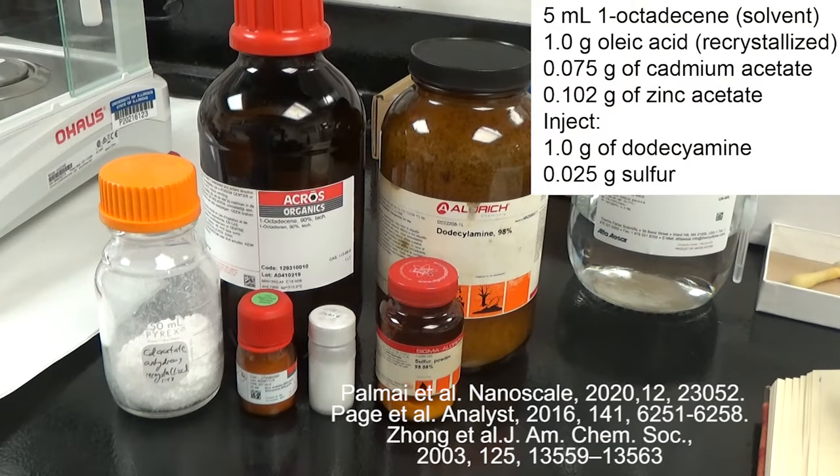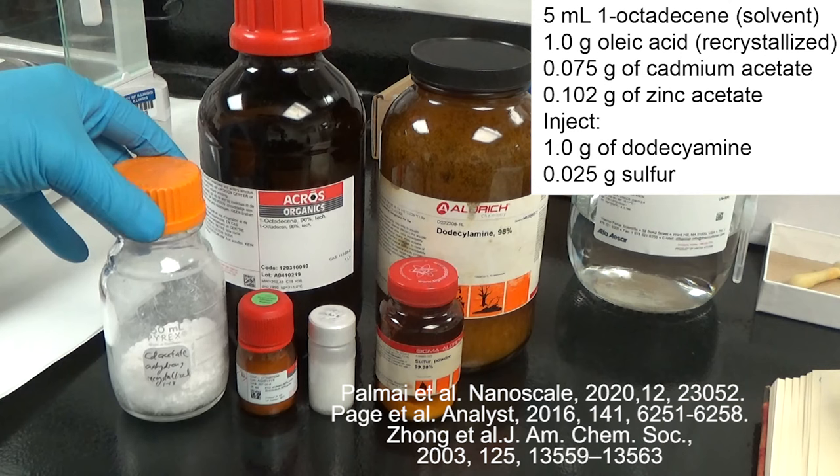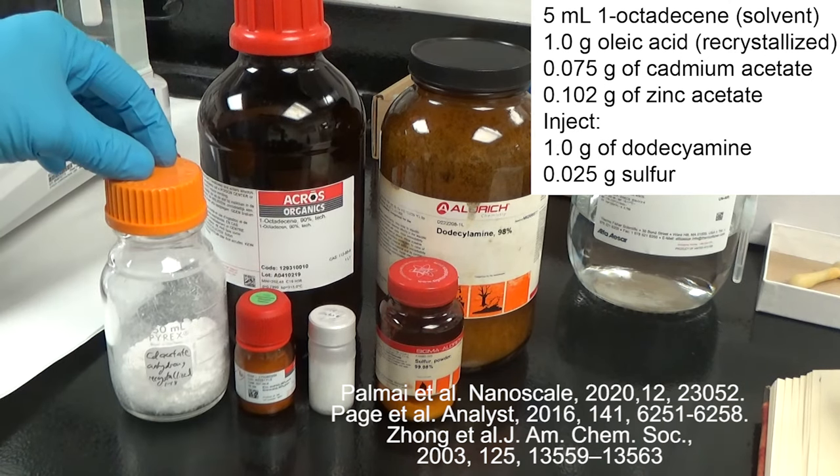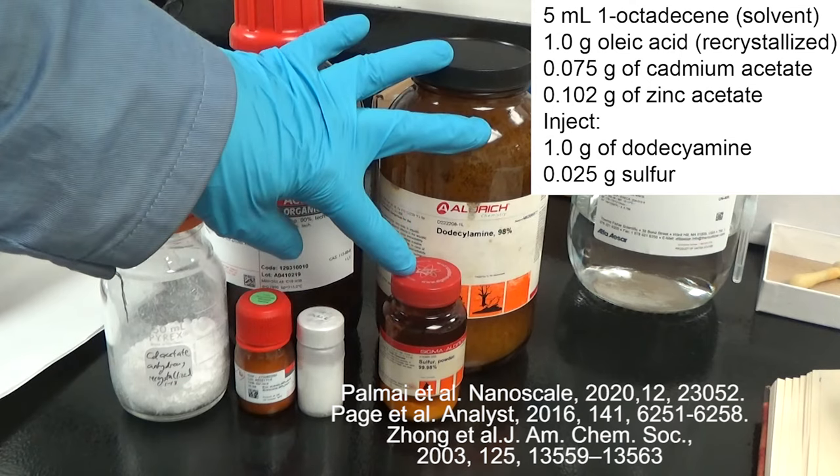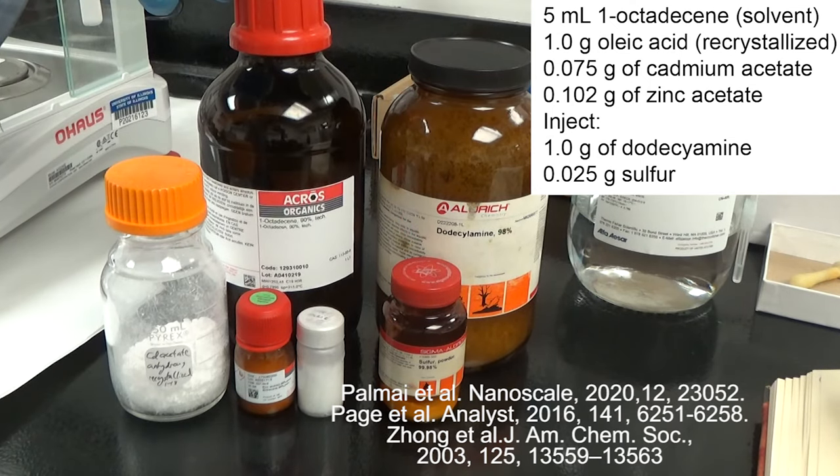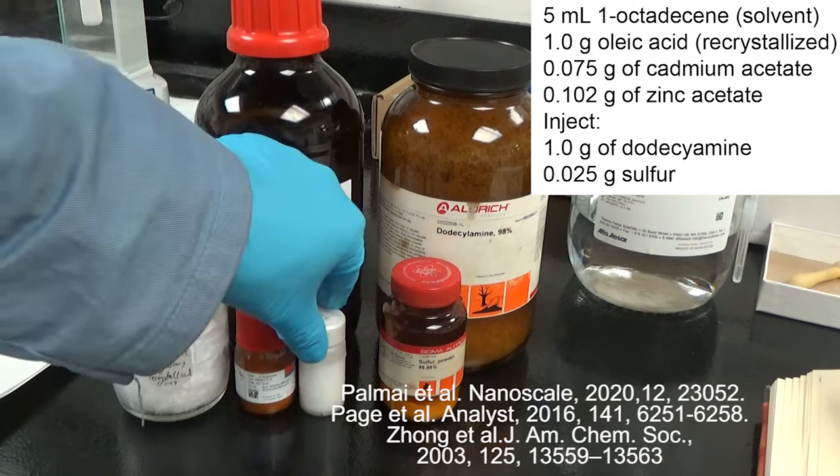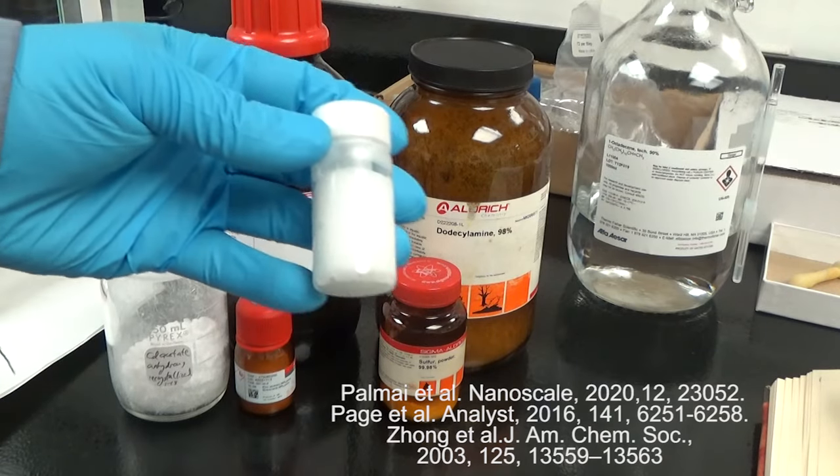All right everyone, we are here to make blue emitting cadmium zinc sulfide quantum dots using the reagents you see here. We are going to inject the sulfur dodecylamine mixture into a solution of cadmium zinc oleate in an octadecene solvent at 310 degrees.